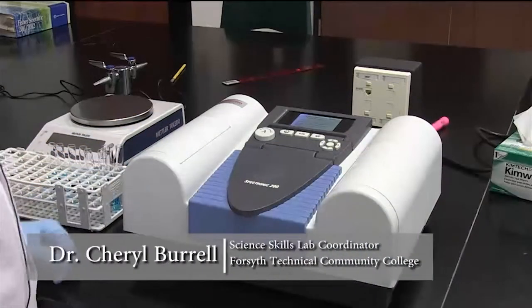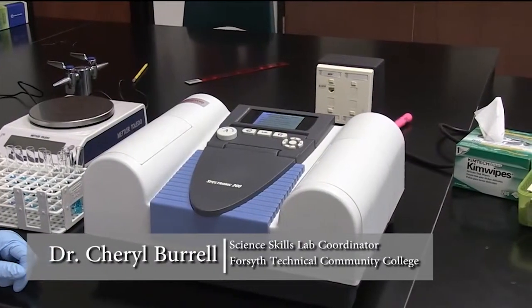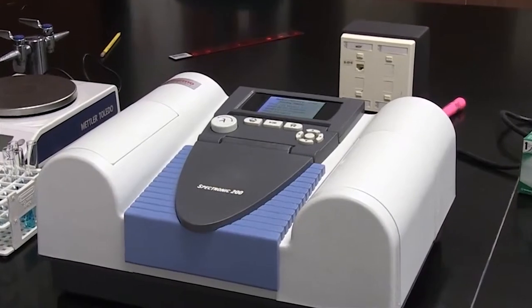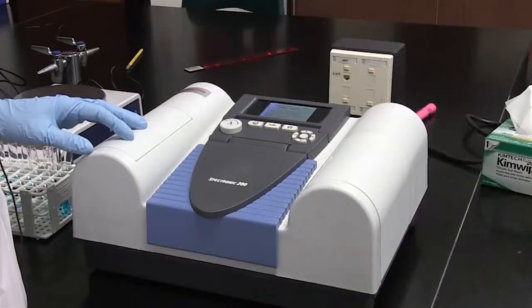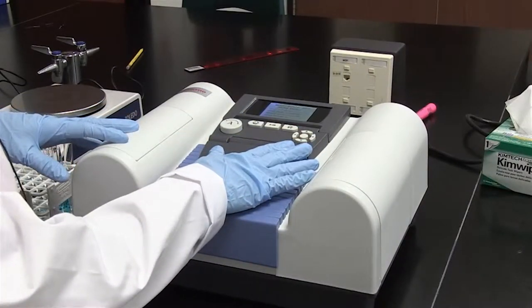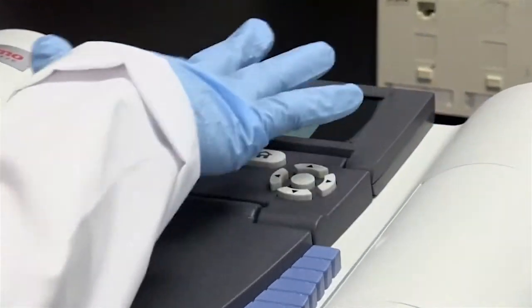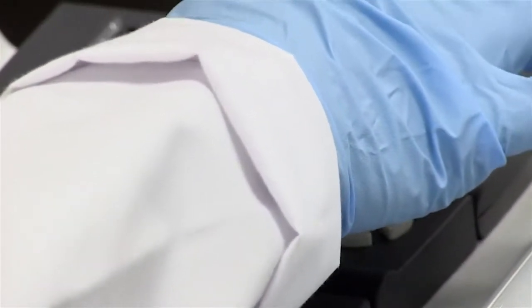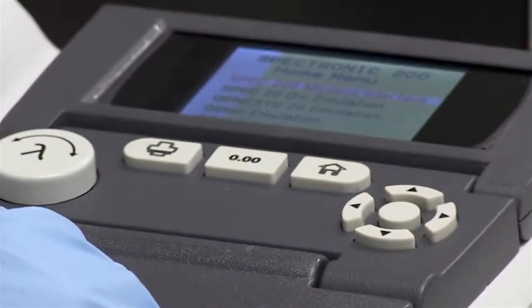This is how your spectrophotometer is going to look — the one you'll probably be using in the lab. I'm going to show you some important features of this spectrophotometer and certain knobs you need to be familiar with. This is the home screen where it brings you to an interface with a series of suggestions that you can select. We're going to use the Spec 200 Modern Interface option.